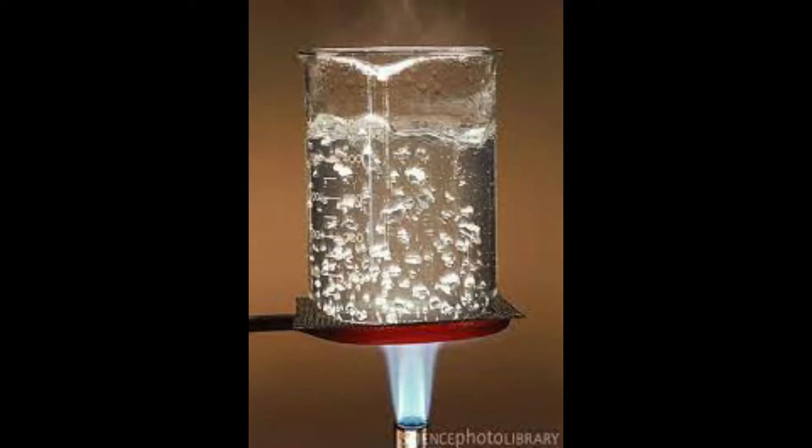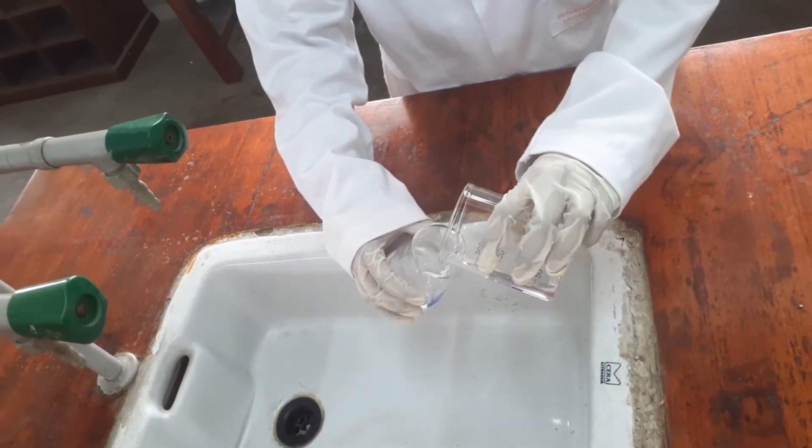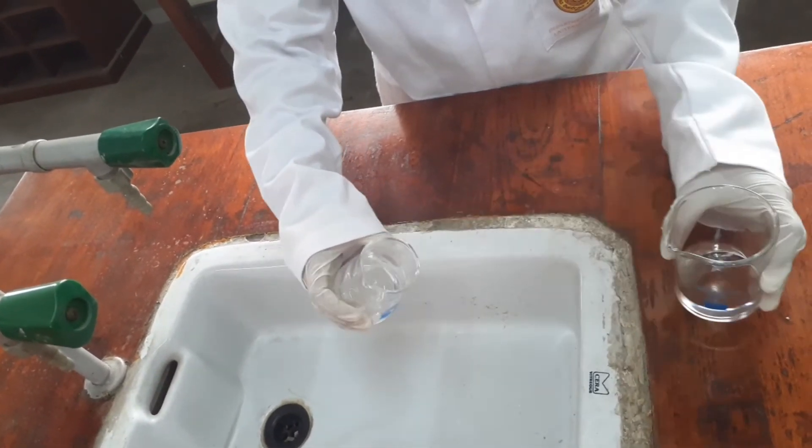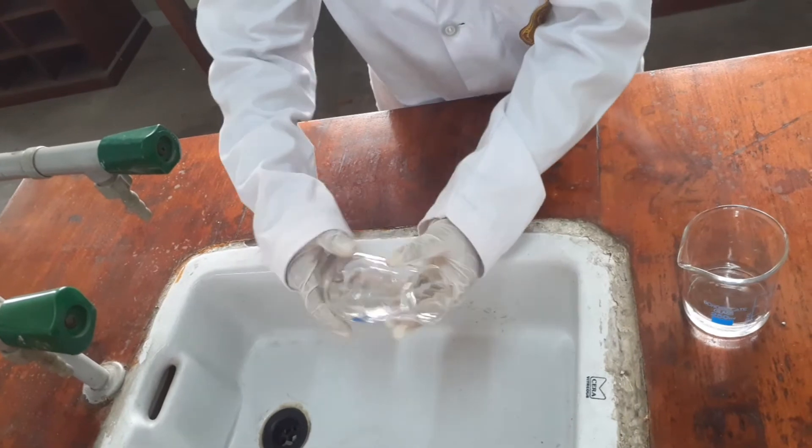However, due to its flat surface, beaker is also used to heat solutions in the laboratory. We can wash the conical flasks and beakers by using pure water like this.